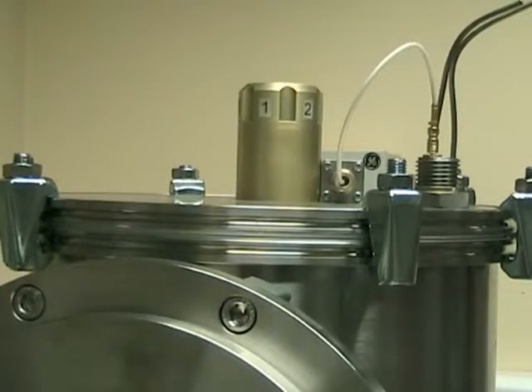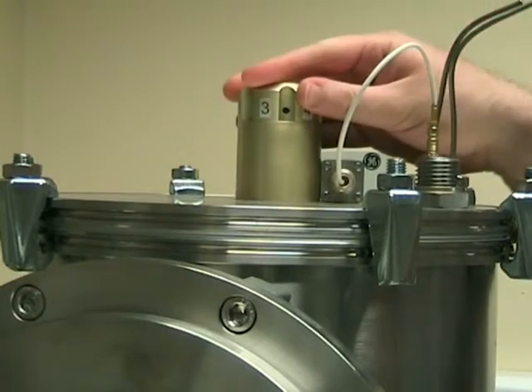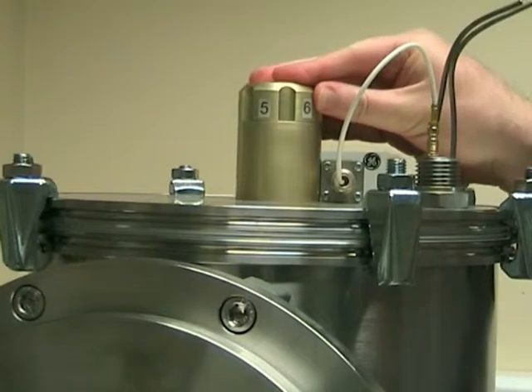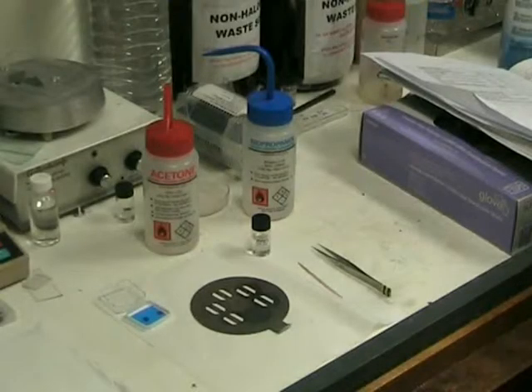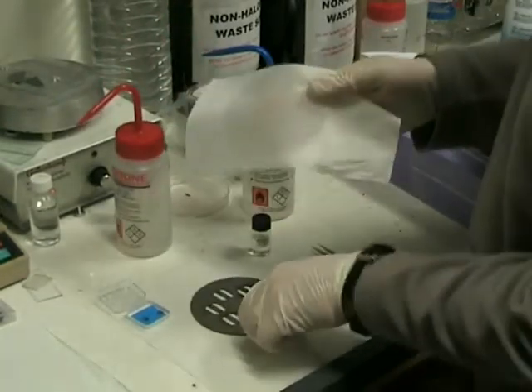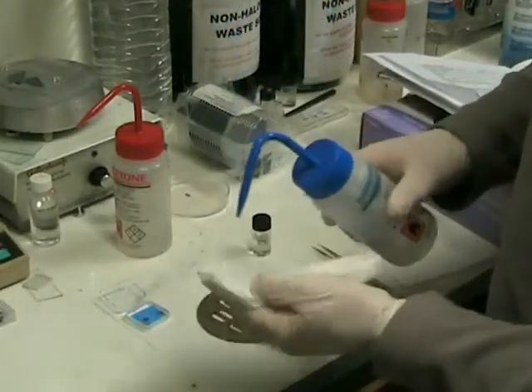The evaporator has five places numbered two to six for samples. Place one is never used for samples, as it is exposed during the bake-out stage. While the evaporator is venting, you can usually put your samples onto the sample holder. Make sure that the holder is clean by wiping with acetone and then IPA.